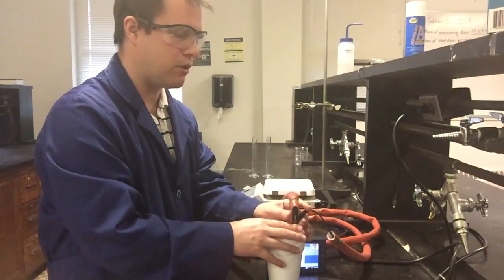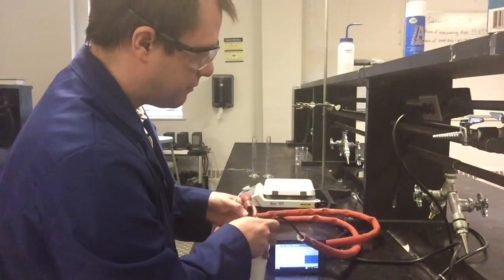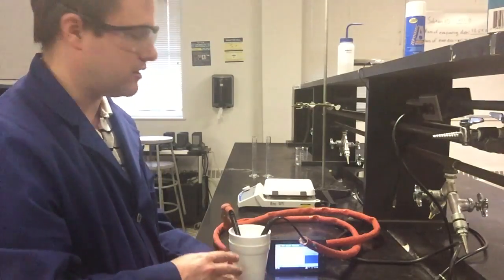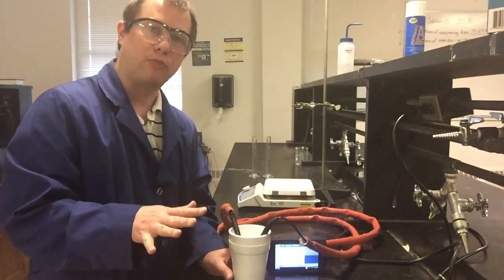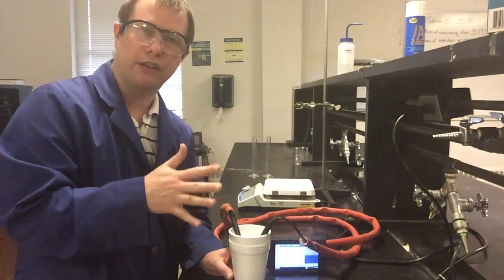And now at this point, I have my 2 thermocouples in the solution. I'm going to make sure it's mixed pretty good at the start. And I've been blocking probably the view of our graph. But our LabQuest is going to collect all this data, and we actually see our temperatures converging on each other, which is a good thing. And what I'm going to do now is record this temperature for 5 more minutes. And then I'll show you what the final plot looks like and what we can be doing with that data in just a moment.